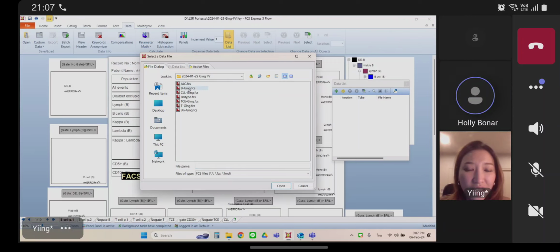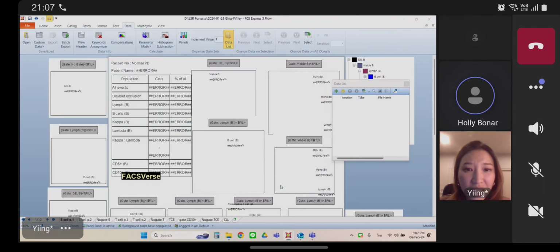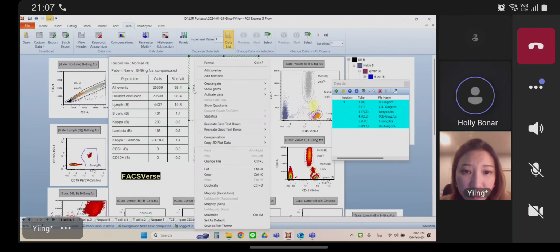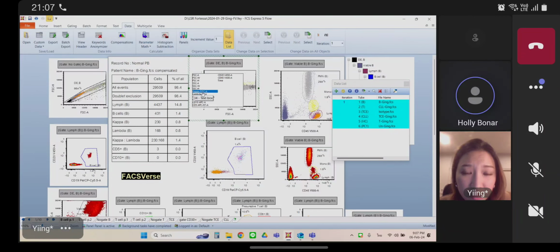Right. It's your LSR layout that's the issue, right? Yeah. Okay. Yeah, you can see the parameter. Okay. So click on that first dot plot there. That's forward versus side scatter, right there in the middle top row. Right. Just click on the plot. Yep, there we go. And then go up to view under the data tab, do view header.